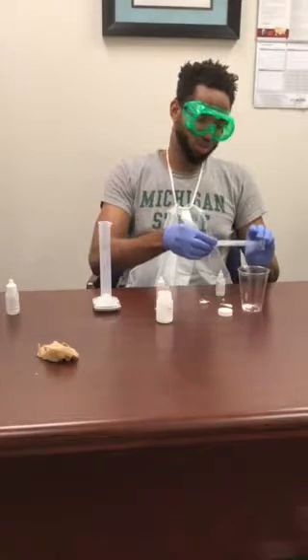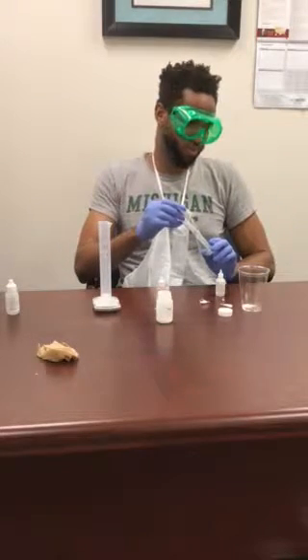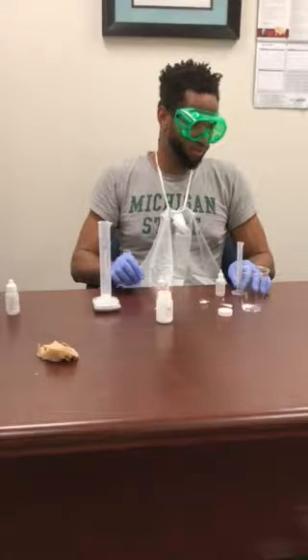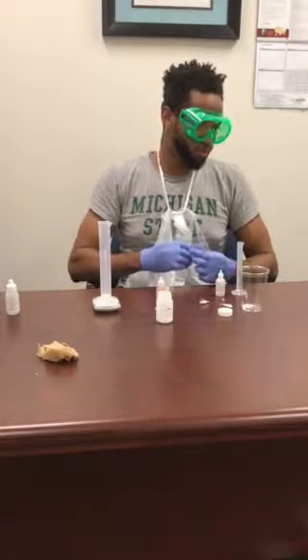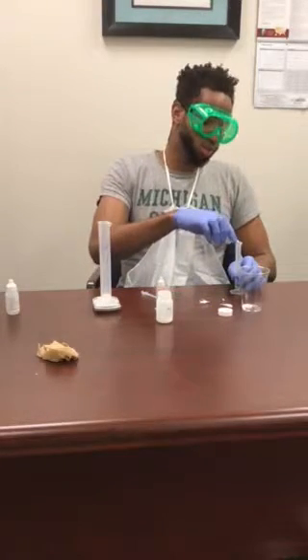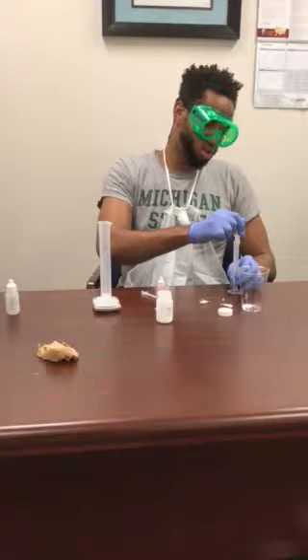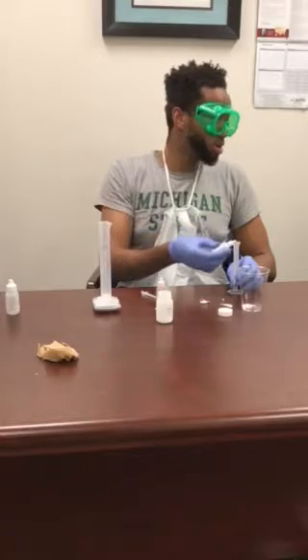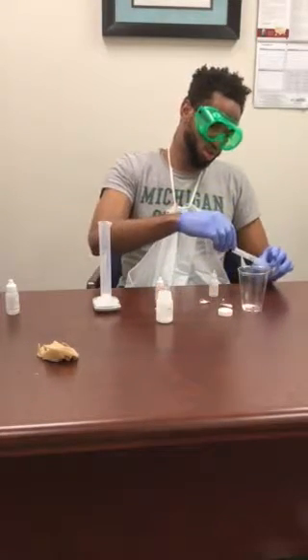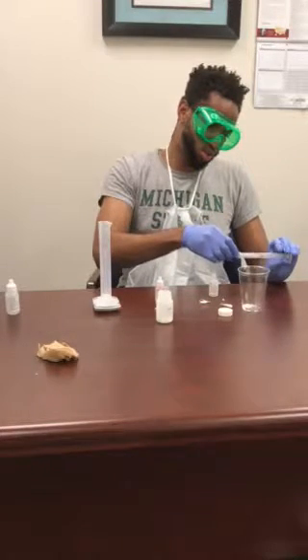Do we know how much or no? No, I don't think so, because they just want us to add drops of it until we reach the end point of the reaction, so we can just have enough to make sure it actually happens. Okay, so just pour the rest of this in. Yeah, just pour some in there. That should be good. Let's see if we can get some of it now, and then pulling it back.